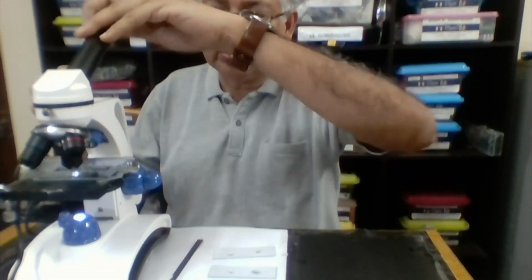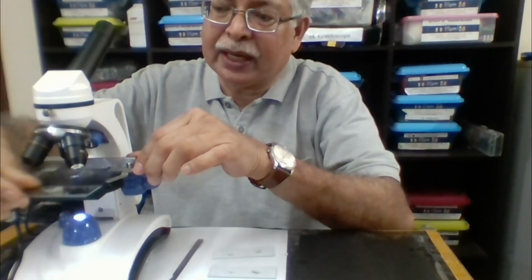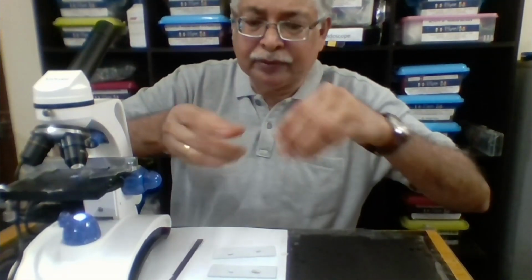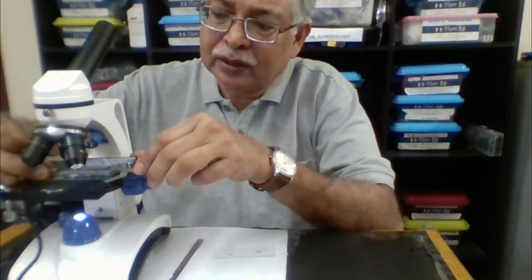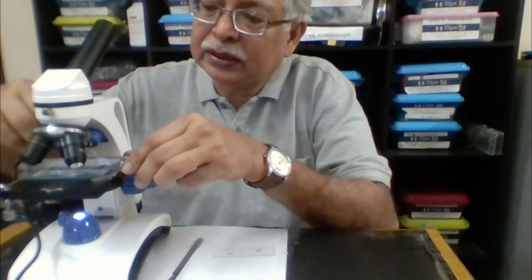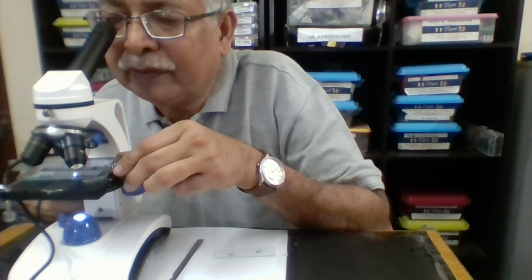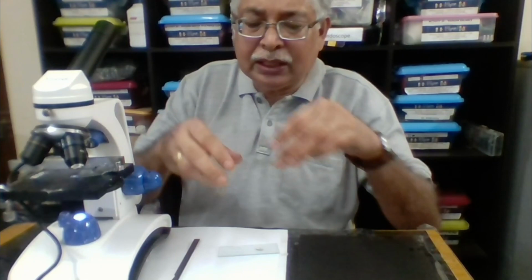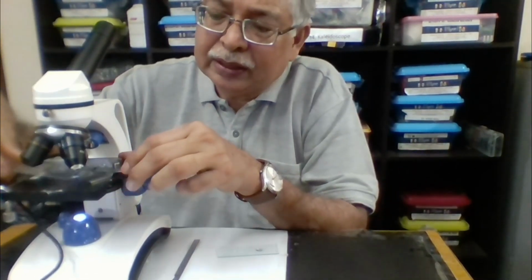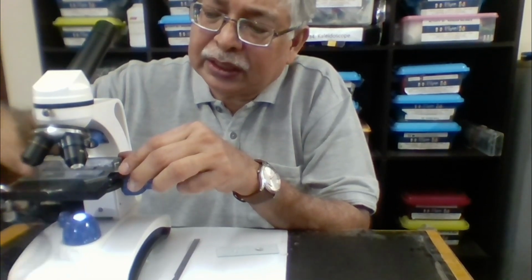Another embryo just to see the magnification, just to see the development. Maybe more development has happened. So I remove this, I change into something else. I use the optical camera again so that I have a proper view. Yeah, this is much more. Maybe the third one is lesser. Let's see, so that you can have a very clear idea of all three types.